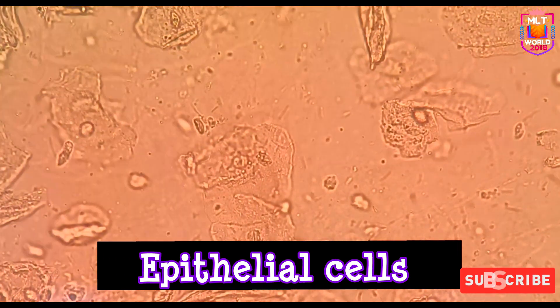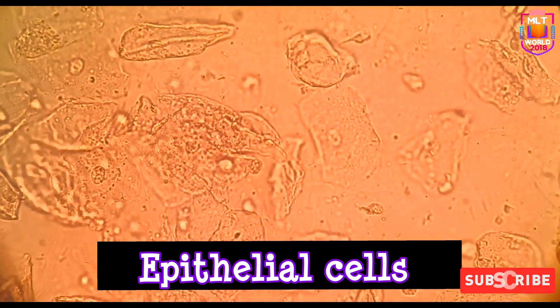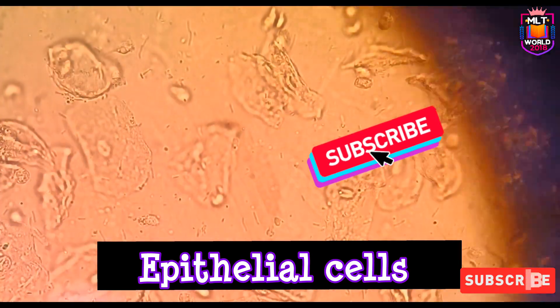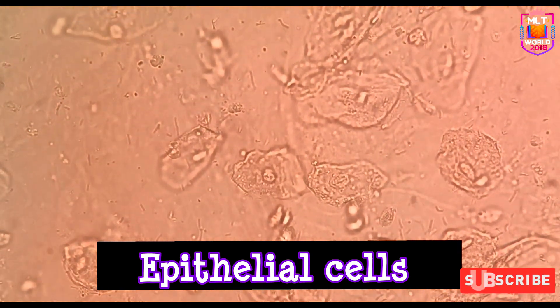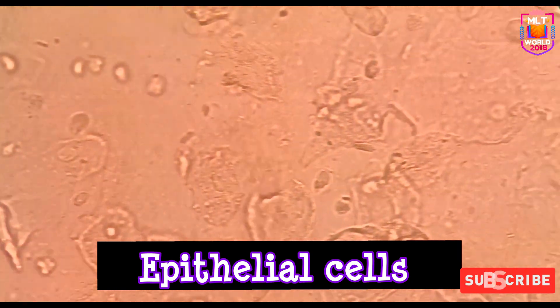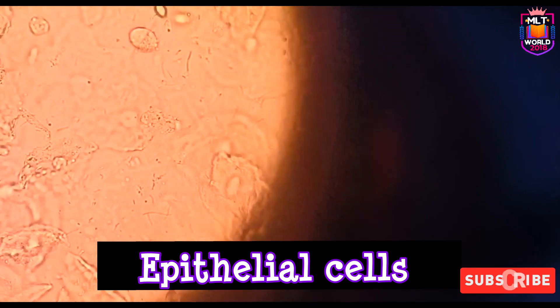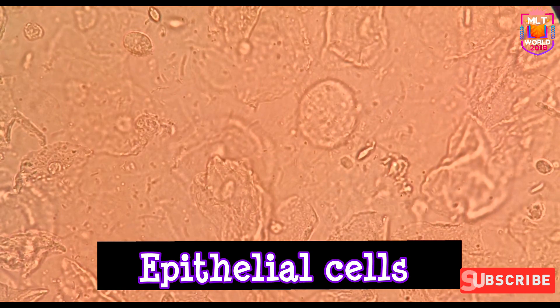Now you see these are the epithelial cells. Epithelial cells are totally different from pus cells and red cells — easy to differentiate. They are bigger in size and there will be one nucleus in the center of the epithelial cell. Epithelial cells come in different shapes. Mostly you will find squamous-shaped epithelial cells. Sometimes they are big and round — at that time don't confuse them with pus cells, because pus cells will not be that much big.